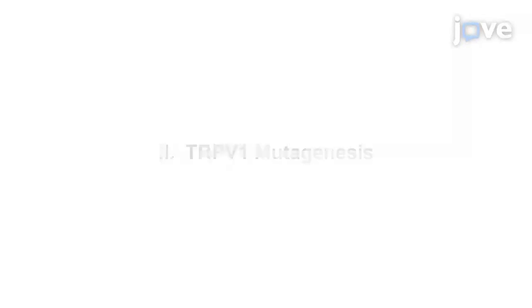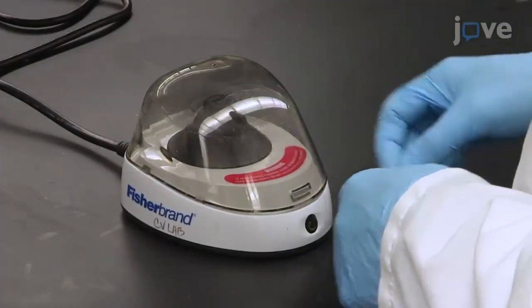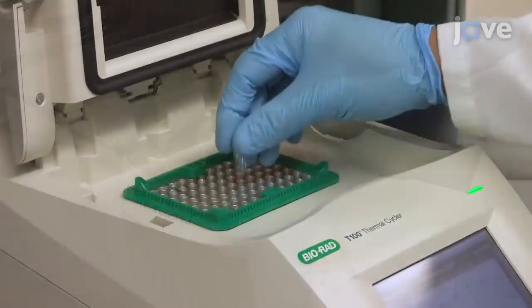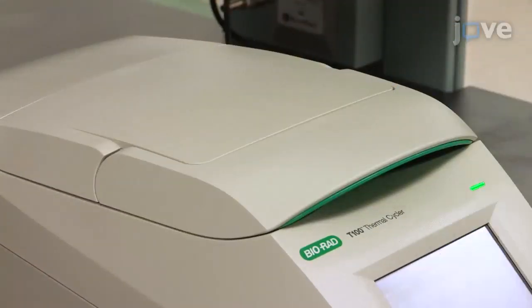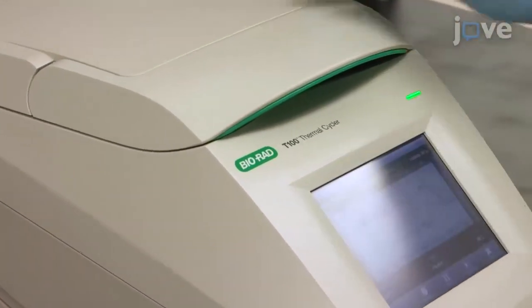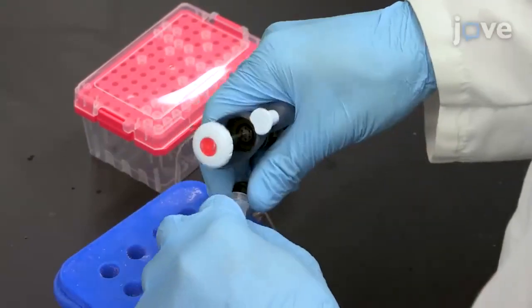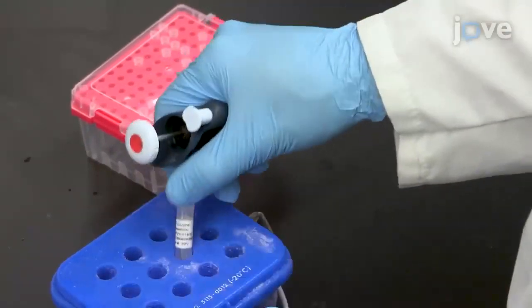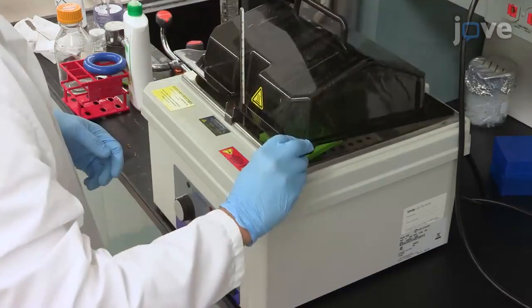Begin this procedure by designing mutagenesis primers with online tools. Prepare the PCR reaction as described in the text protocol and spin the mixture. Place the tubes in the thermocycler and perform PCR mutagenesis using the parameters listed in the text protocol. Then add two microliters of DPN1 enzyme to the reaction, mix, and incubate at 37 degrees Celsius for 30 minutes.